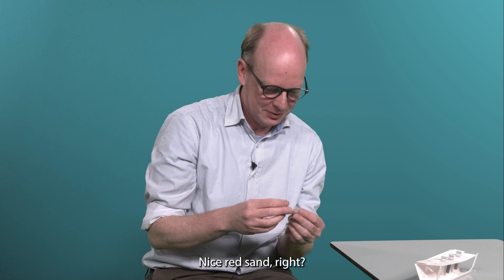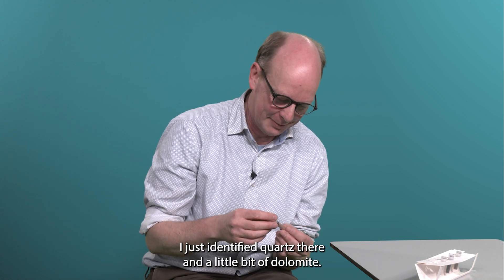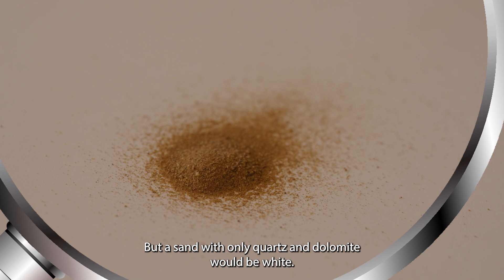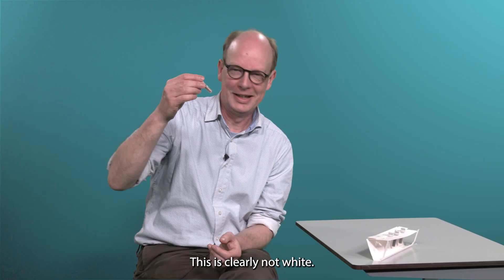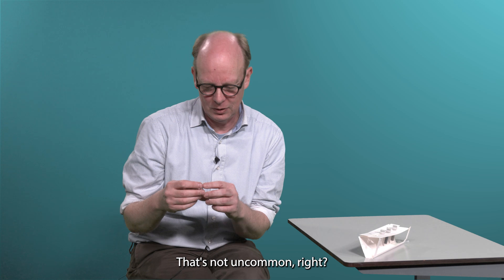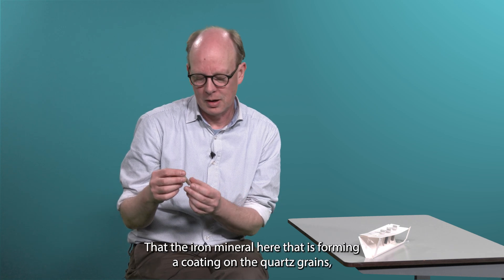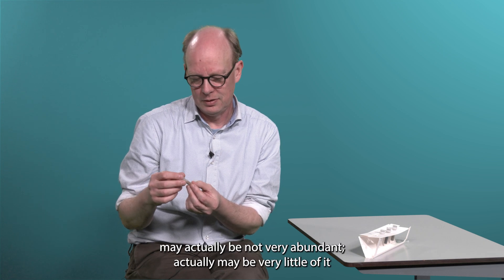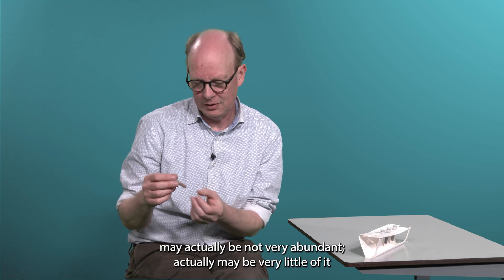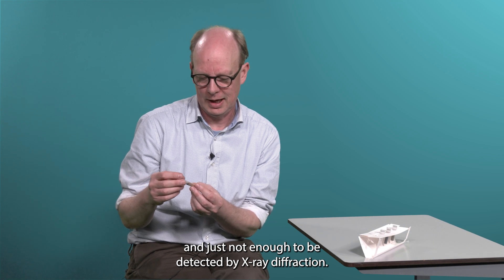Nice red sand, right? I just identified quartz and a little bit of dolomite. But a sand with only quartz and dolomite would be white. This is clearly not white. That's not uncommon — the iron mineral here is forming a coating on the quartz grain. It may actually be not very abundant, maybe very little of it, and just not enough to be detected by X-ray diffraction.